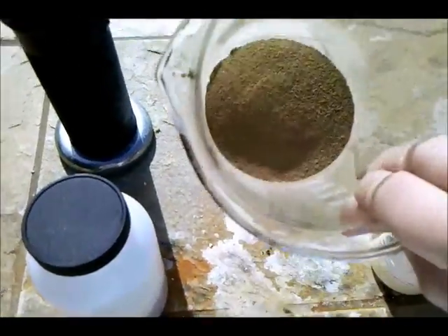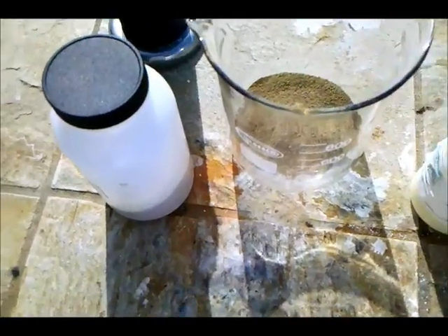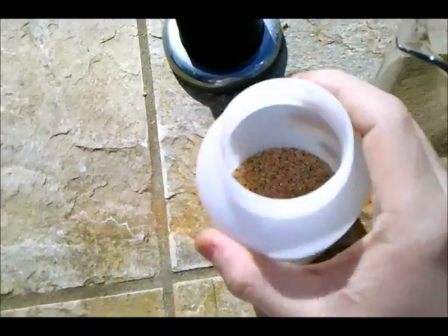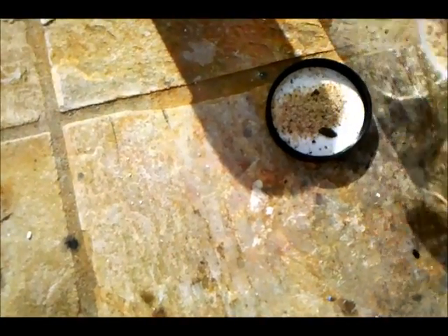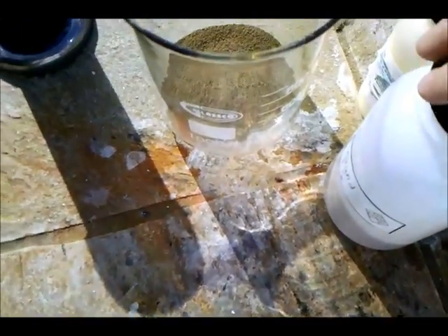As you can see, my sand is really fine. As to how I did that, I started with sand that looked like this here — it just looks like normal beach sand, and that's exactly what it is. And to grind it up, I used a ball mill.